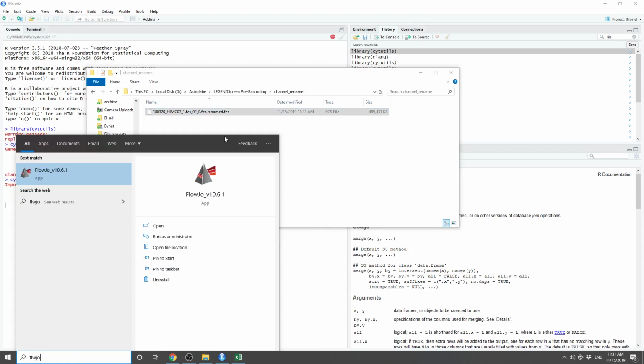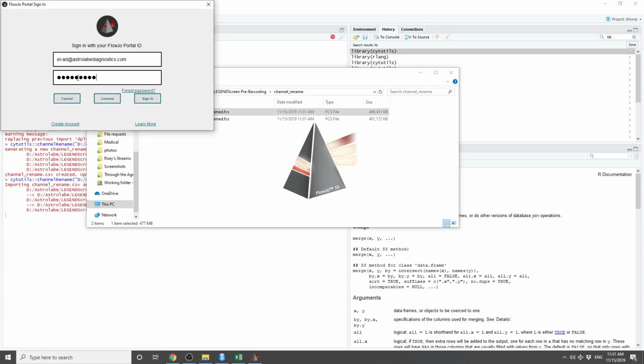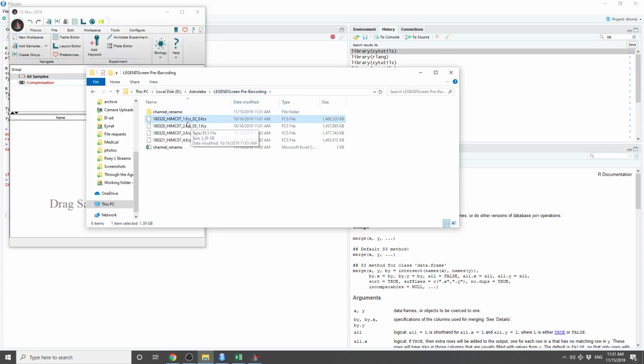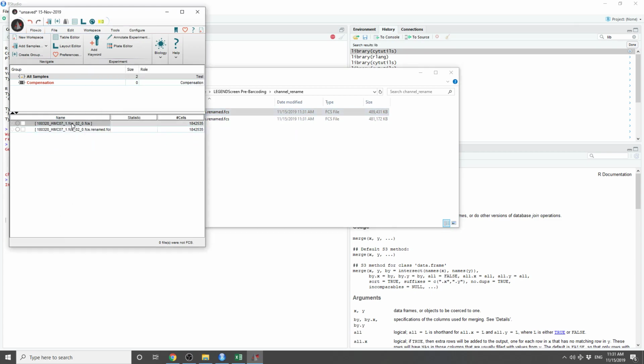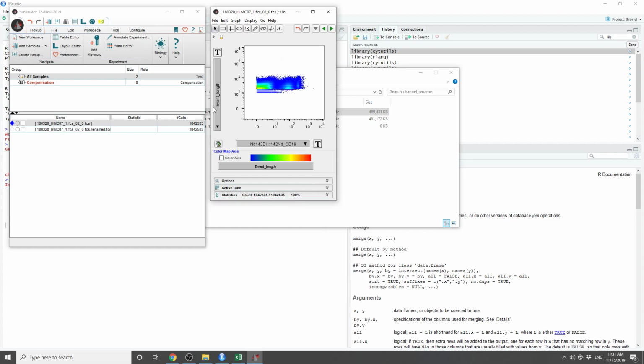renamed.fcs. So I will quickly load FlowJo just to see that the panels are indeed different while this is renaming in the background. So here we are in FlowJo, and we can load the original file, and we can load the renamed file, same event count, and here is the first file. Let's put, let's say CD19 versus CD3. So here's the file, and now I'm going to switch to the next file. Look at the x-axis. The channel name has been updated.